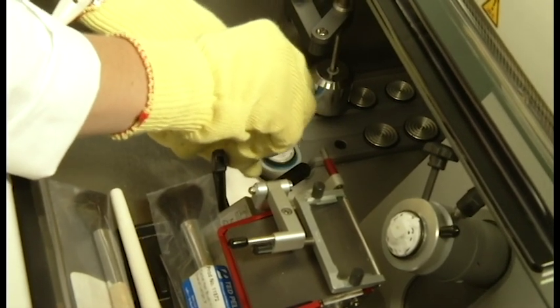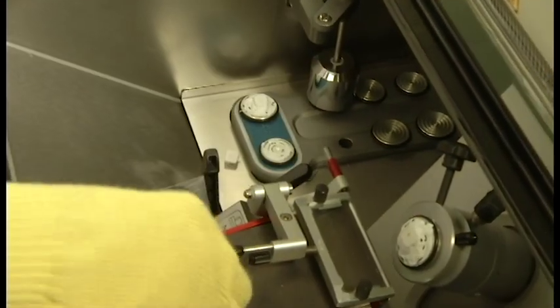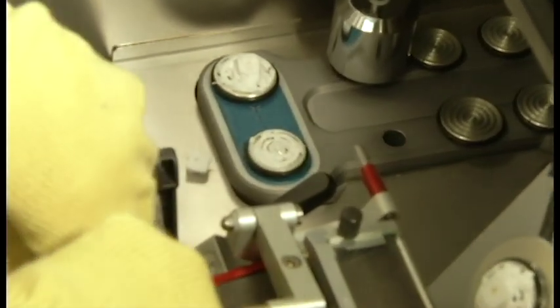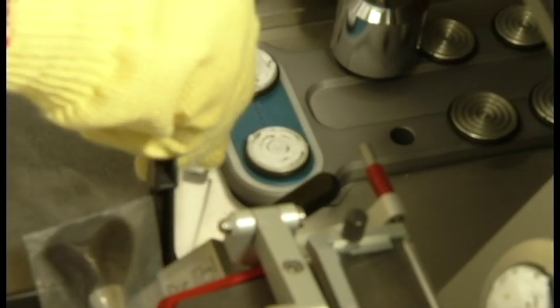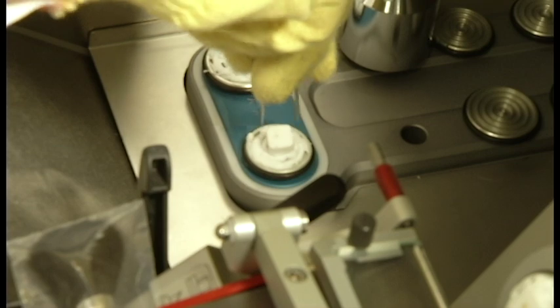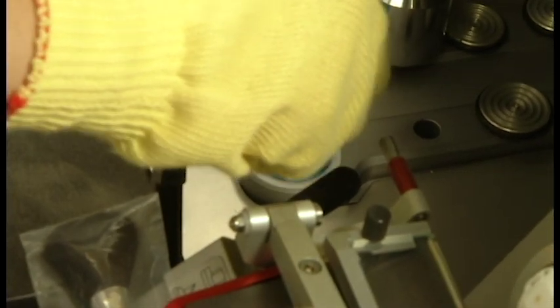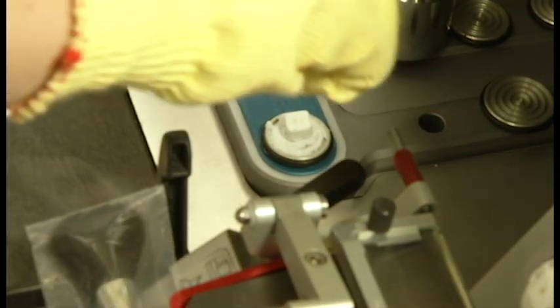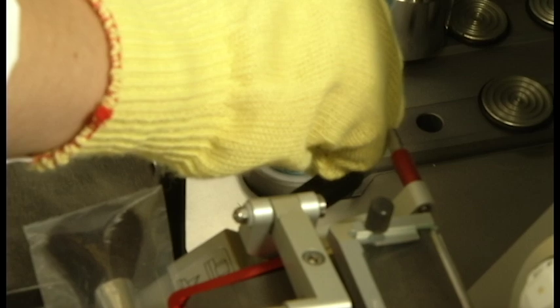Use tweezers to pick up the block being mindful of which side you want facing up and which side you want into the back of the block. Apply slight pressure with the tweezers to make sure the block adheres to the base. Take the bottle of media and apply additional media around the base of the block to ensure that it will stay on while you are sectioning.